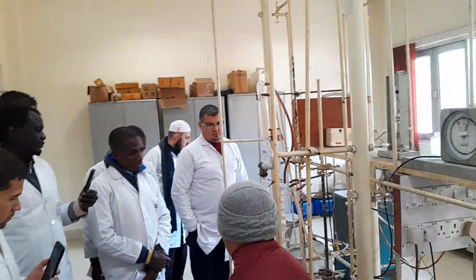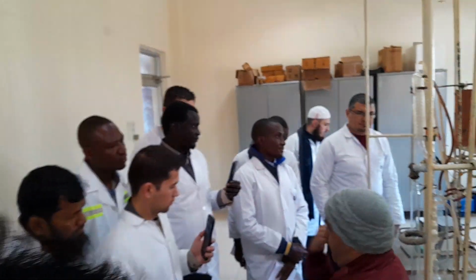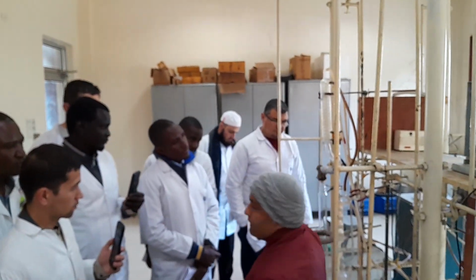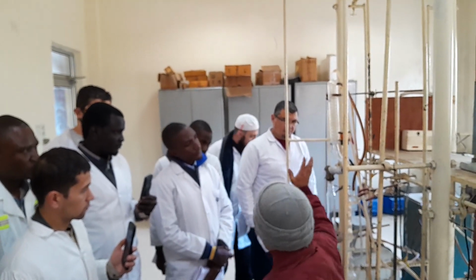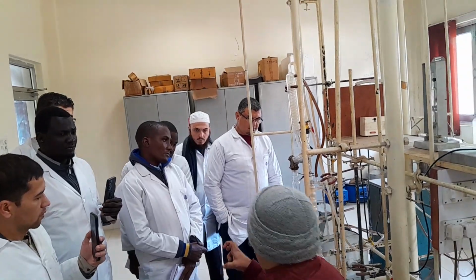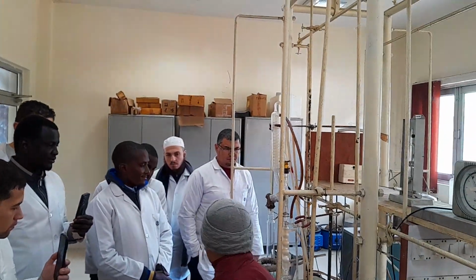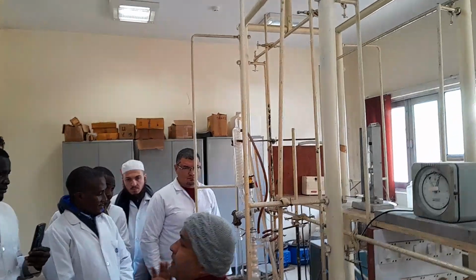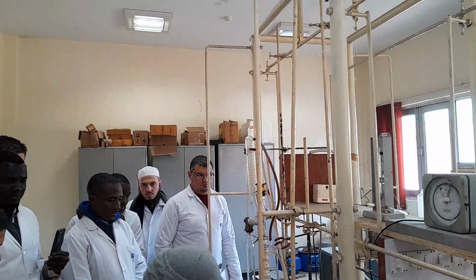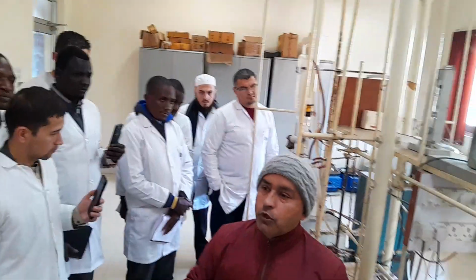Okay, now C5 onwards is going to be condensed completely. Here you will find the hydrocarbon up to 100 degrees centigrade or 105 degrees centigrade along with the water. You are going to collect it through this fraction cutter into the receiver, because all three things will be at minus 20 degrees centigrade.